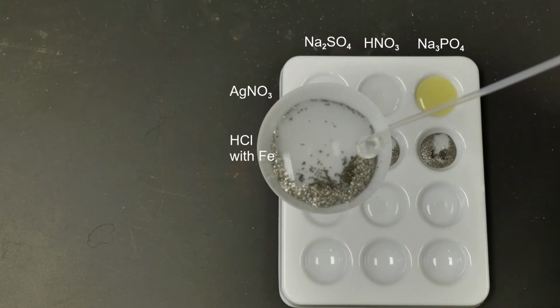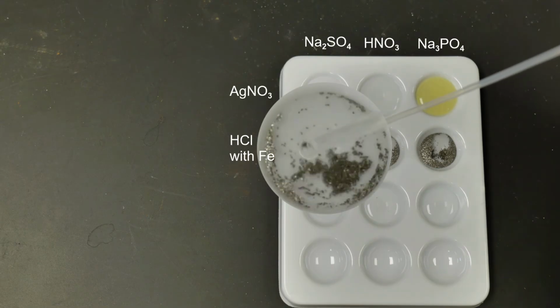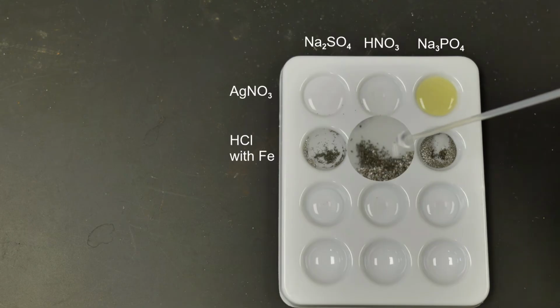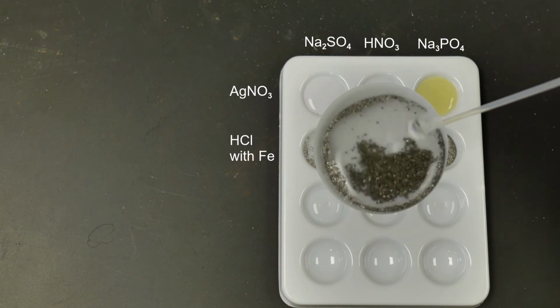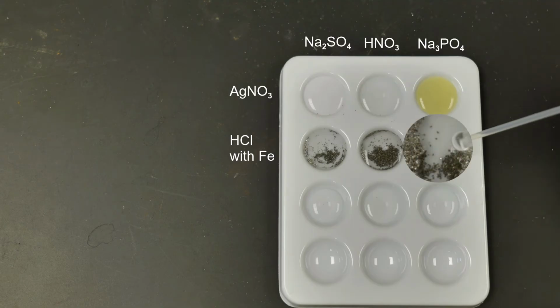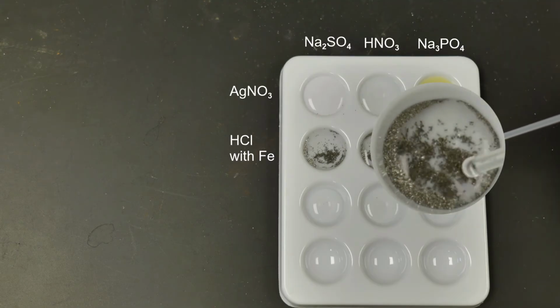So again, do we notice any change here as we add this hydrochloric acid in? Okay. Then we have our hydrochloric acid and iron filings with nitric acid. So add this in. Again, do we notice any change here? And lastly, we have our hydrochloric acid with iron filings added to the sodium phosphate.